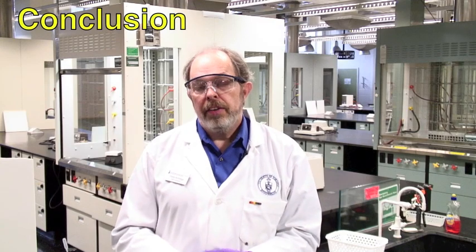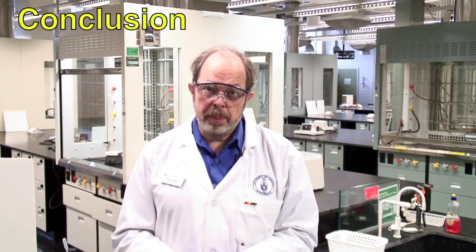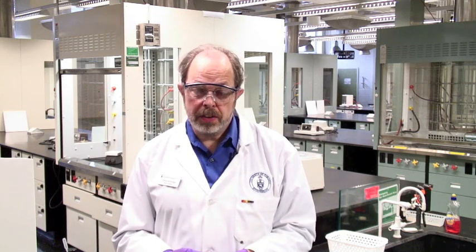In conclusion, filtration is a separation process designed to separate solids from liquids and sometimes to wash the solids while you're on the filter. You should now understand how to filter solids on the macroscale equipment.